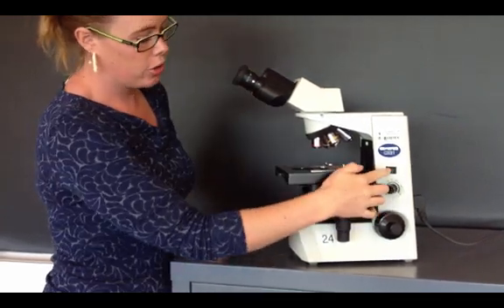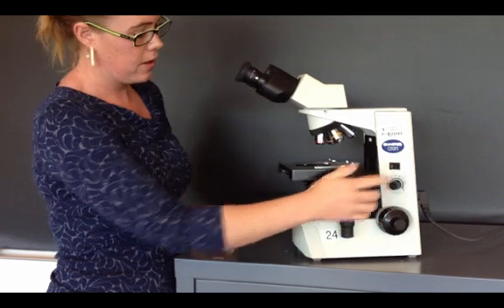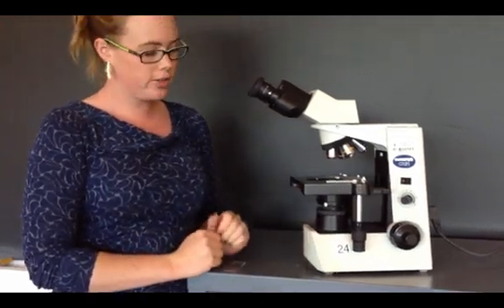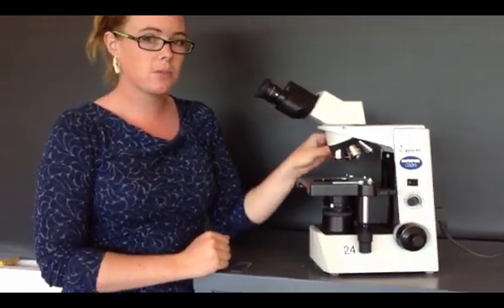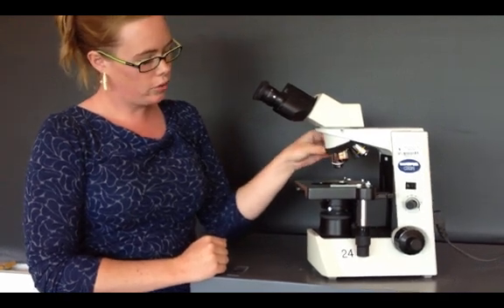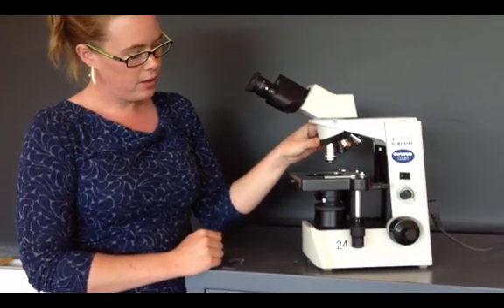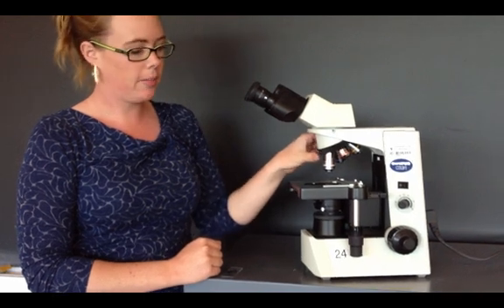Now, you can turn your microscope off. And make sure also that you have the lowest objective clicked. You do not want to store it on a high objective, because that risks more damage.